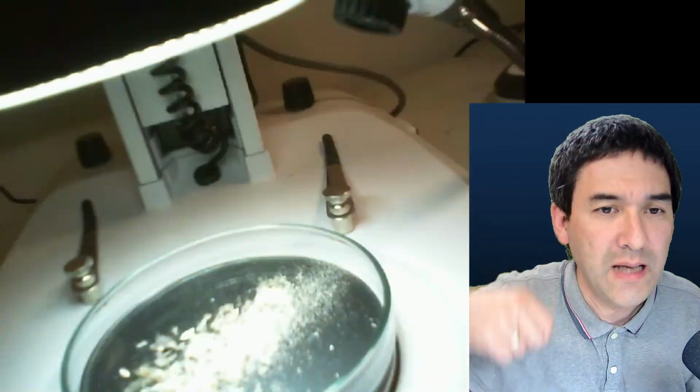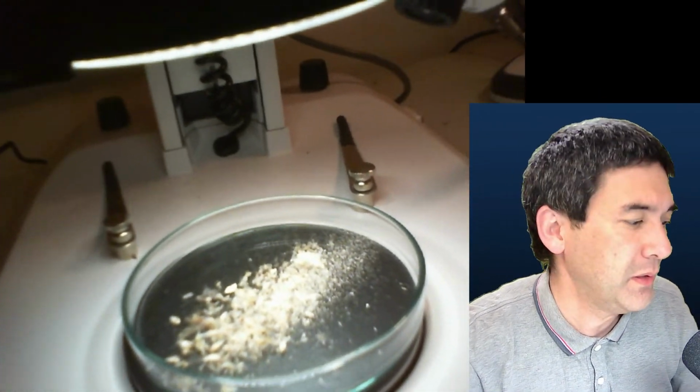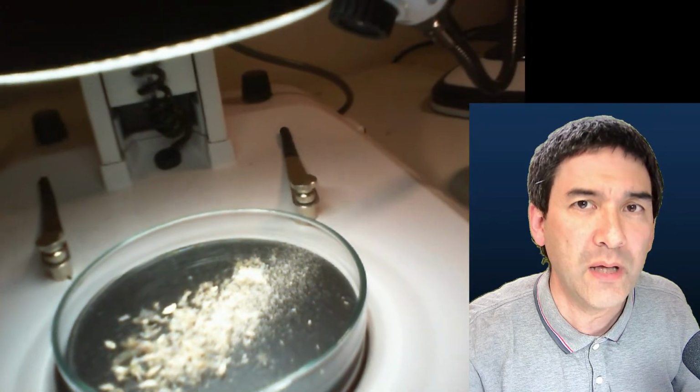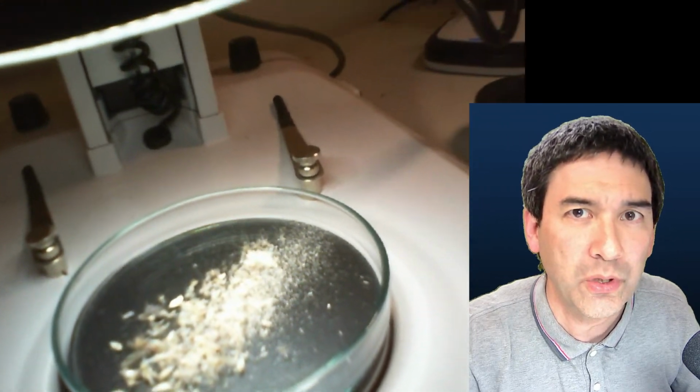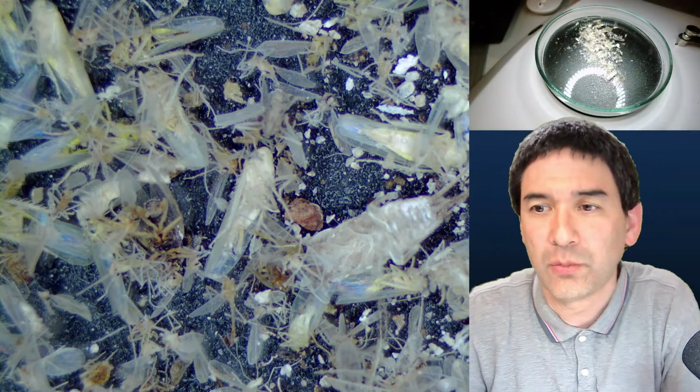Okay. And over here, this is the camera that captures the stage here. Just wanted to show it to you very briefly. But I'm currently working on a video for my other channel that explains this whole new setup as well. Okay, so that's the thing that we have here.